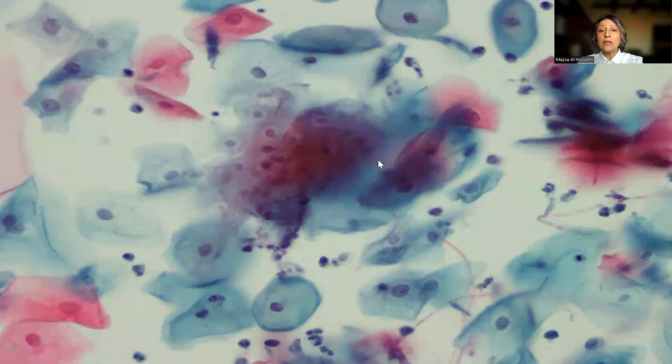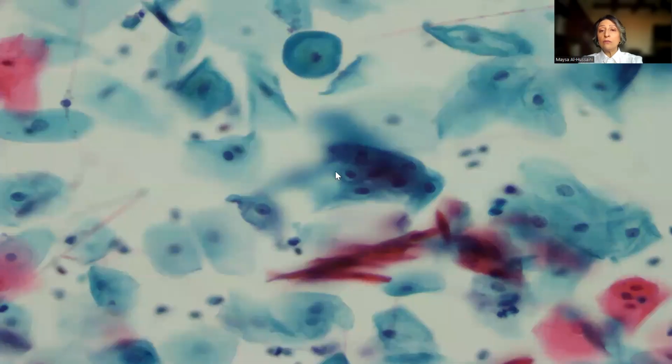However, Candida infection can sometimes be associated with the presence of some perinuclear halos reminiscent of, but not quite exactly like, koilocytes. And this is the pitfall that we need to pay attention to. So if we encounter Candida in a Pap smear, and some adjacent squamous cells reveal this perinuclear halo, we should really be very careful not to overcall the Pap smear as showing features of koilocytosis or HPV-related changes. I hope you find this clue useful in your practice.